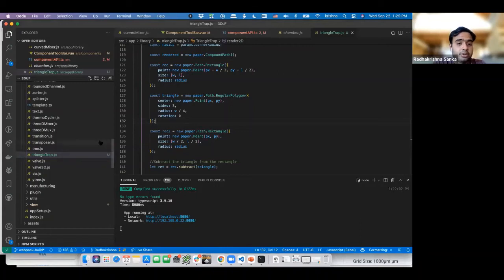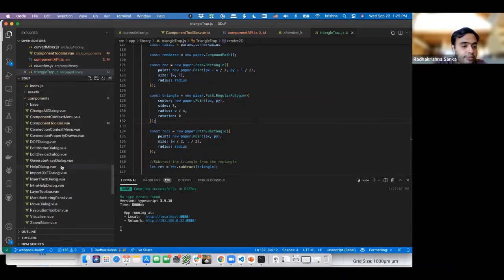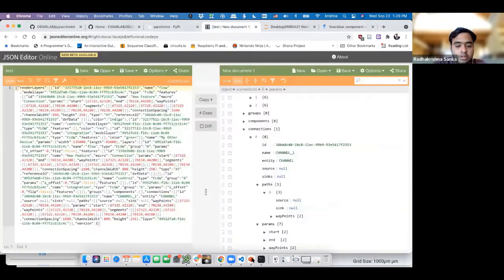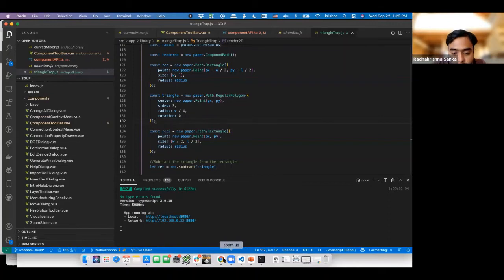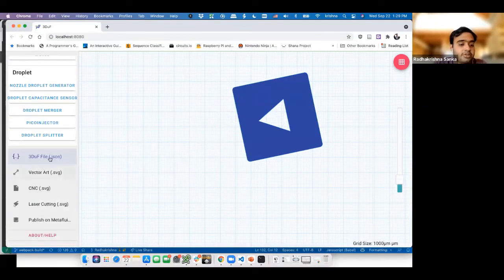And for now, because we just need to show that it's going to work, I'm going to go to the manufacturing panel, because what we want to do is, sorry, wrong spot. Yeah, so basically we want this to fire when we click on this button here, 3DuF file .json, when we want to save this one. So this is in what we call the manufacturing export panel.